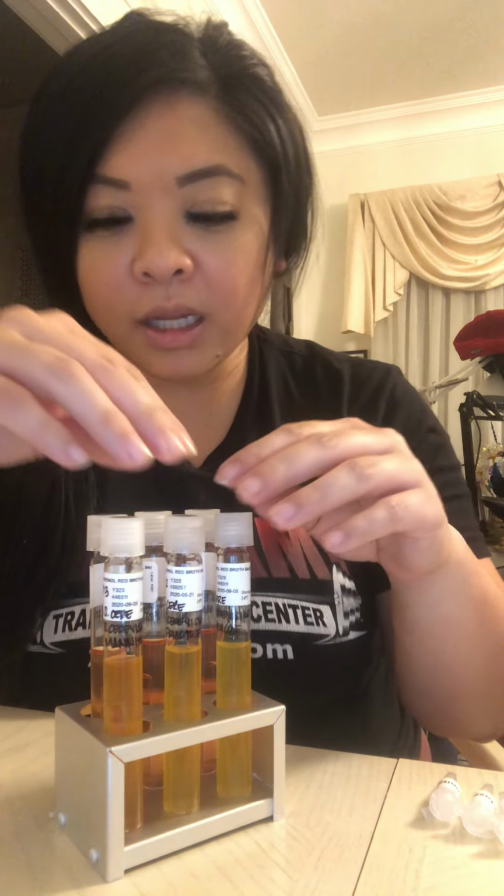So basically, what we're looking for during this experiment was to determine what fermented in those microbes that we have. And if the broth stayed red, it would indicate that no fermentation had occurred. If it turns yellow, it means that fermentation did occur with gas. And if it turns orange, it means that fermentation did occur, but there would be no gas. So here we can start with my yellow tubes.